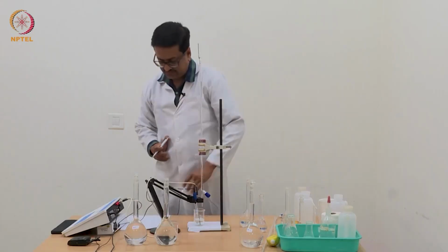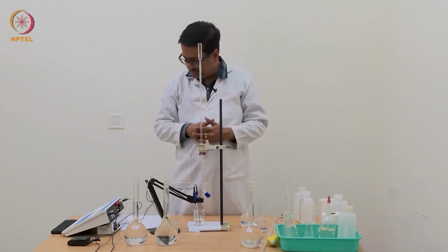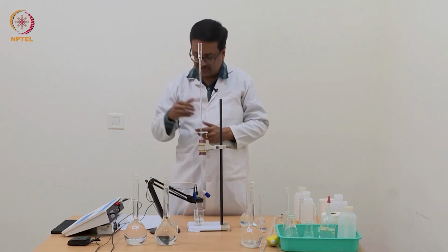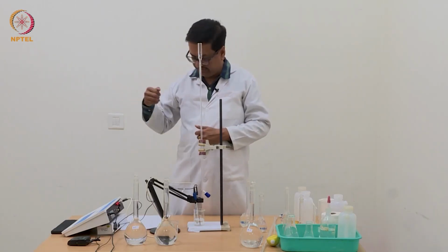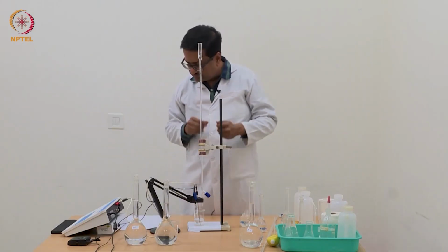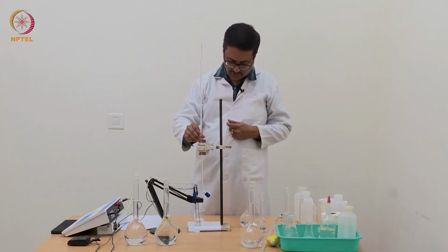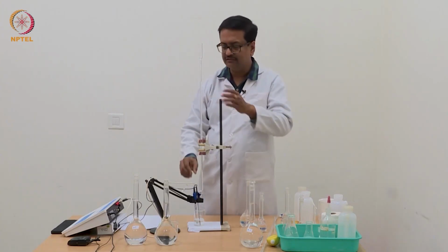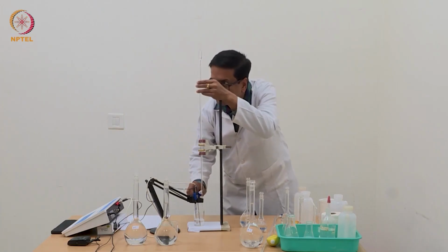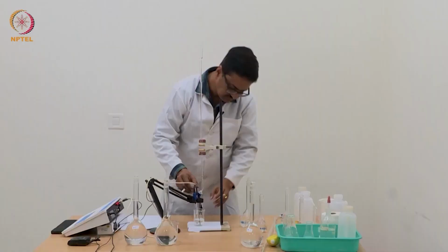So what you see here is there was a small region where the delta pH increased initially by 0.04 and then 0.06 and then 0.09, and now again the increase is just about 0.07. With the next addition I presume that it will be again less than 0.07, which will then indicate that we have just crossed the half neutralization point.